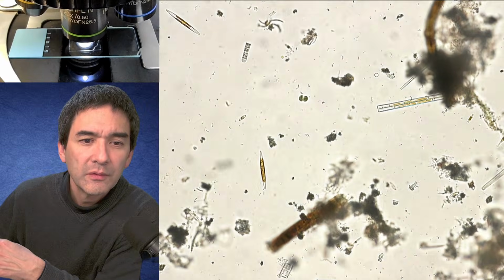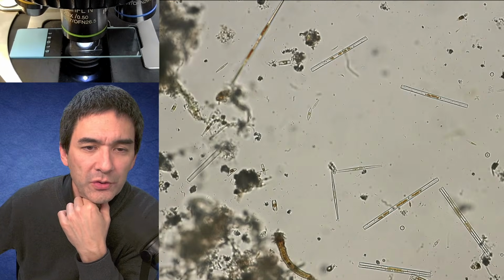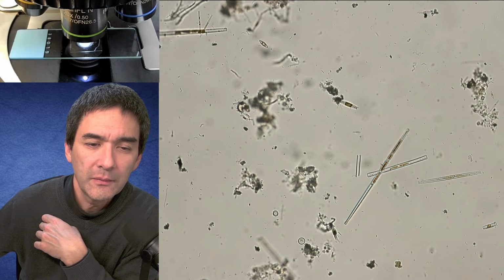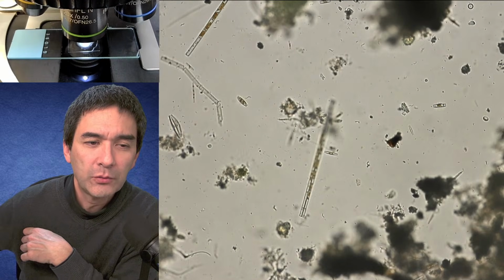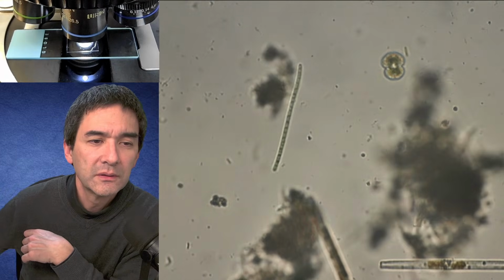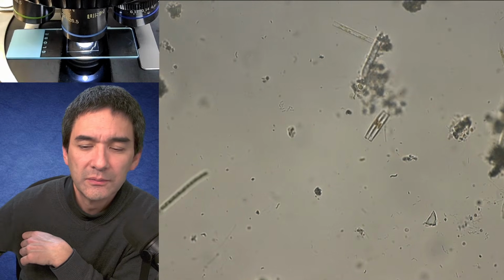Let's go up a little bit with the magnification. You can of course see a whole bunch of microbes swimming around here, probably also bacteria. Over the last couple of days, quite a lot happened, so the number of microorganisms greatly increased. But let's remember a little bit how this looks, and let's see if the other microscope is able to resolve that. We're going to see.